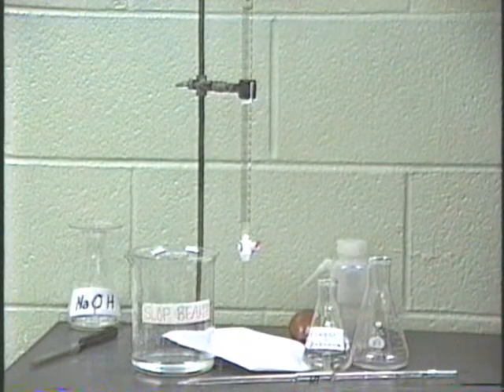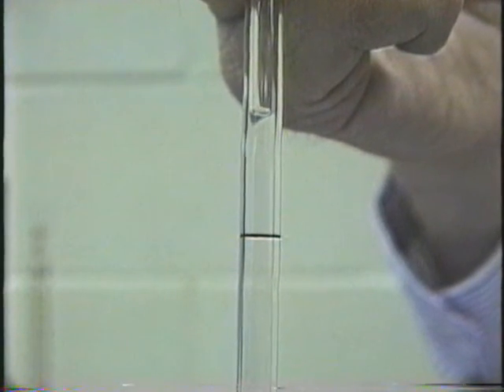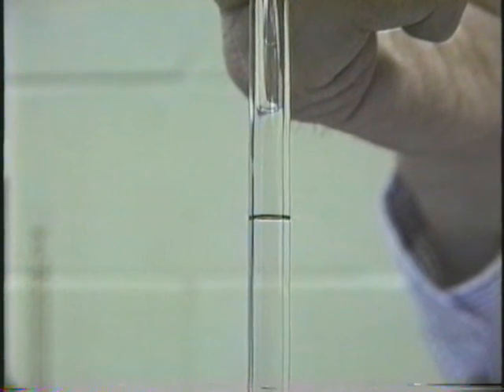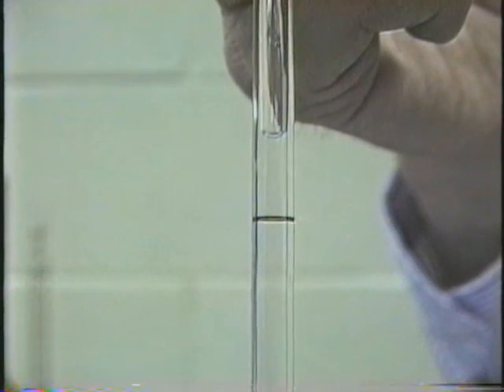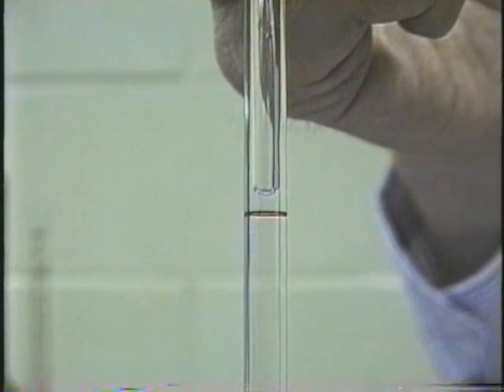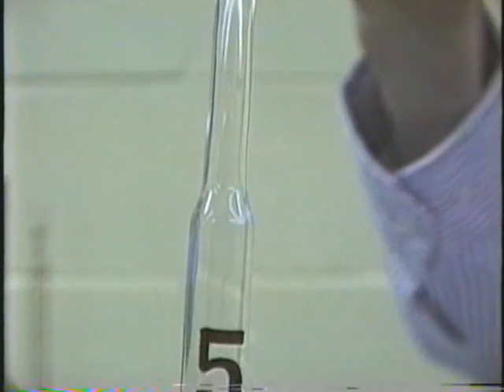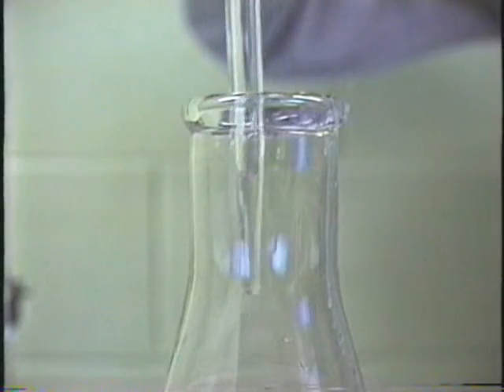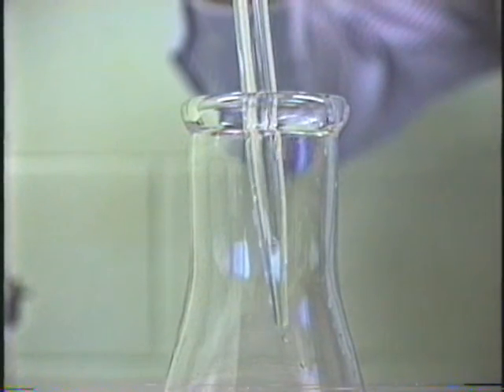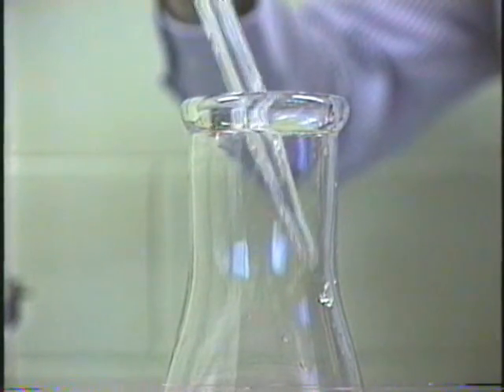Let's look at that in close-up. When the level of the liquid is above the 5 milliliter mark and your thumb is on top, you slowly release the pressure of your thumb and the liquid will start to drain out. Now you just keep it going, a little bit of patience until the bottom of the meniscus just hits the 5 milliliter mark. Then you put pressure on and now you have your 5 milliliters. Here's a close-up of the drainage of this pipette. Now you see, when you're through draining, what you do is just touch the pipette to the side. Whatever comes out will come out.